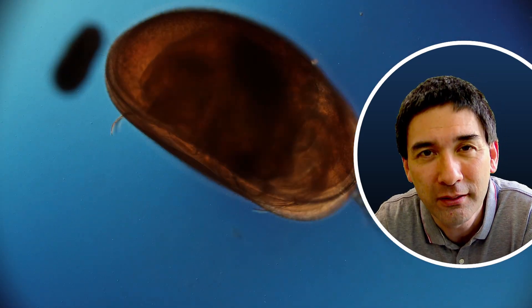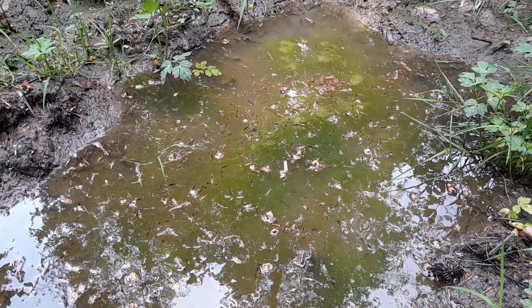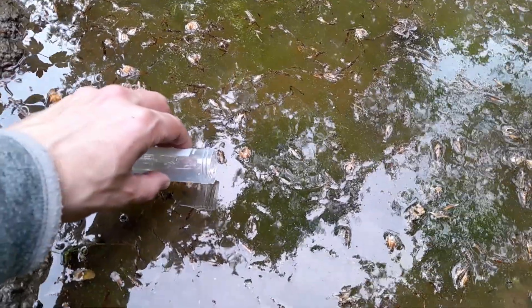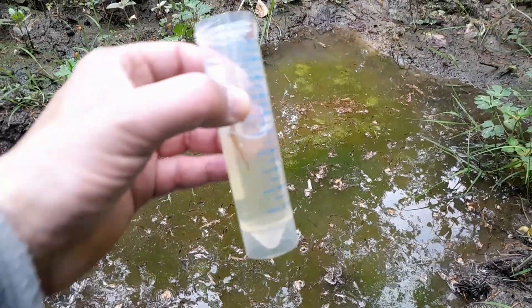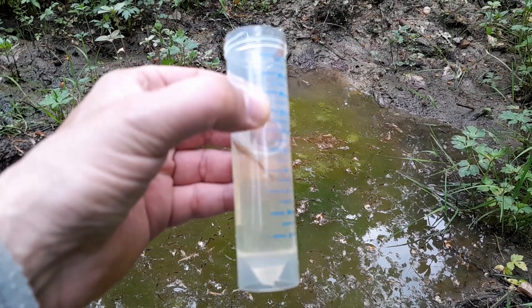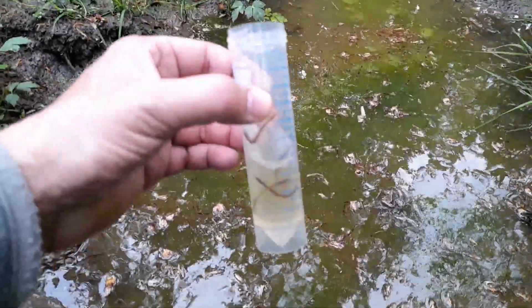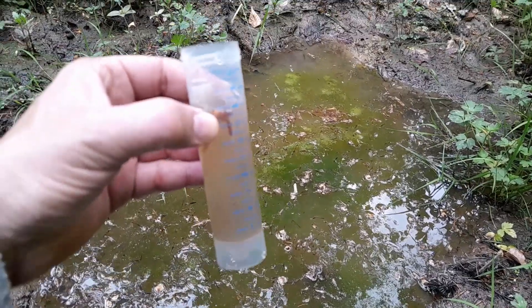I'm going to show you how I collected those. It does not look very appetizing, I have to tell you. There are quite a few filamentous algae in here, and I don't have my scissors or tweezers with me. It does look green, so maybe I'll find something interesting, but I think it's a little too clear — I need some sediment and solid material as well. So I'm agitating the ground a little bit, making it more turbid, which is a sign there is more solid material — and maybe this is going to be more interesting.